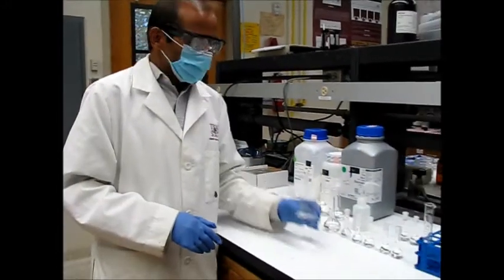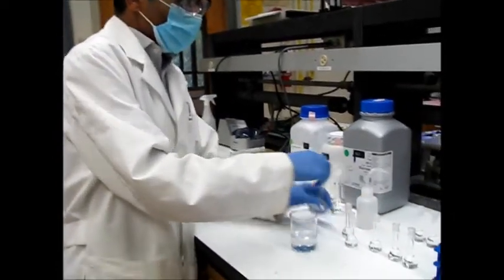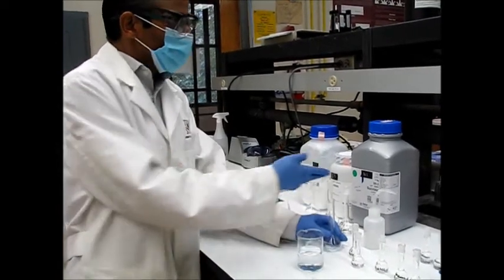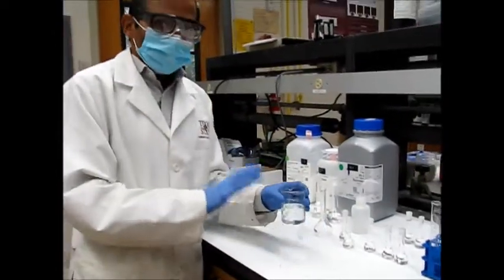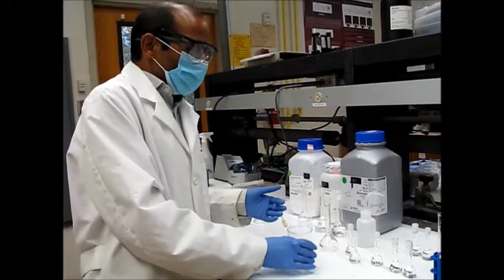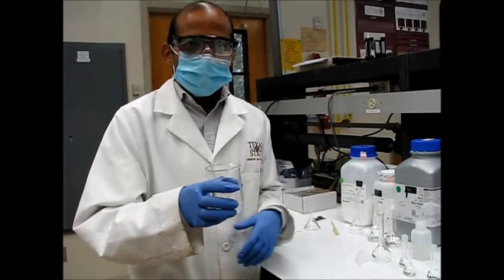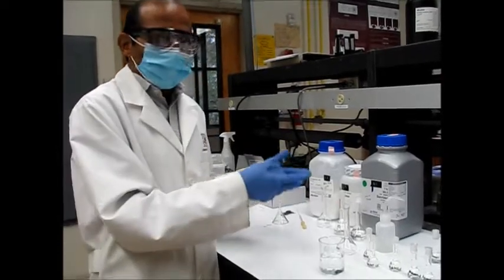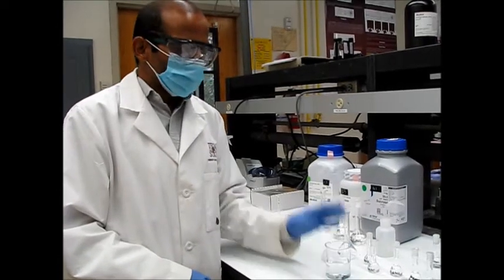We have completed the experiment and generated some waste. These sugar solutions — sucrose, fructose, and galactose — must be disposed of properly. Never spill them on the bench, otherwise ants will appear and surfaces will become sticky. Always dispose of these in the aqueous waste container. Improper disposal will result in ants in the lab the next day, so be careful and dispose properly.